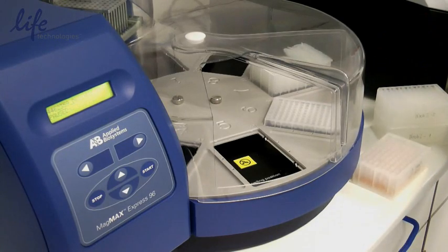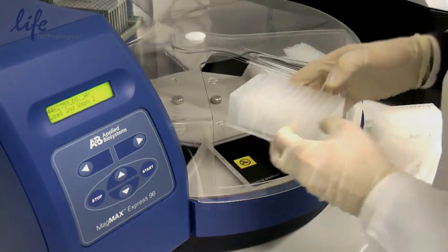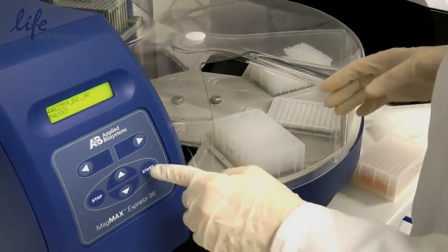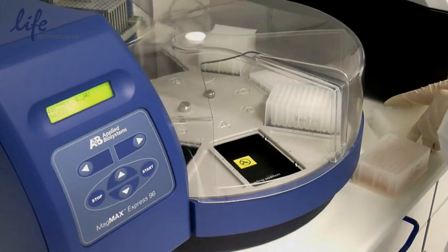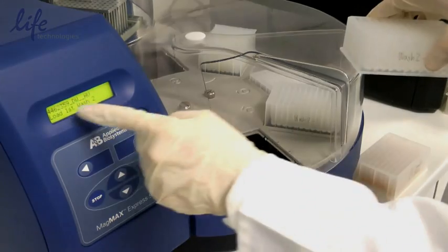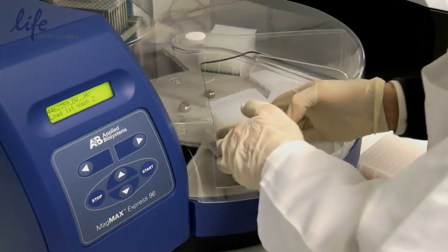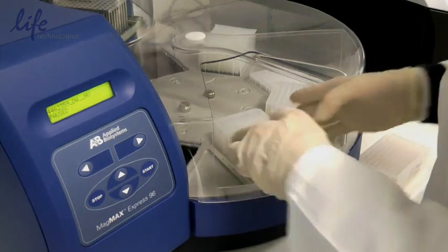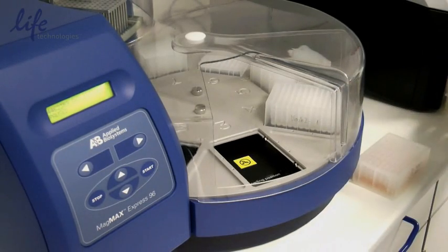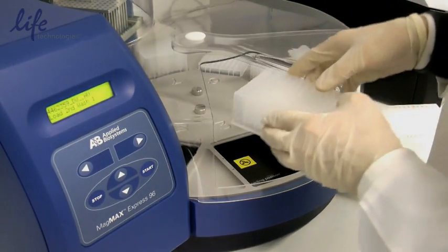The next plate is going to be the second wash 2. Then we load the first wash 2. Then we're going to load second wash 1.